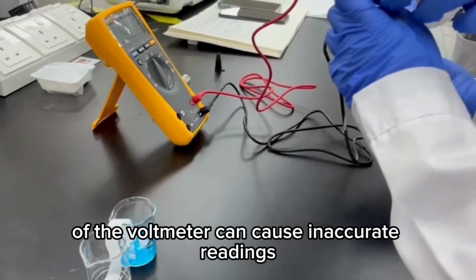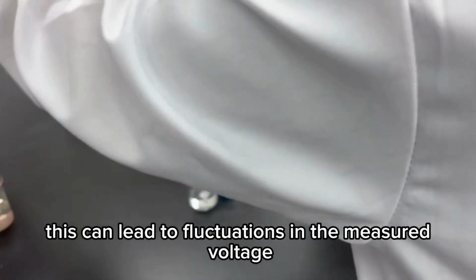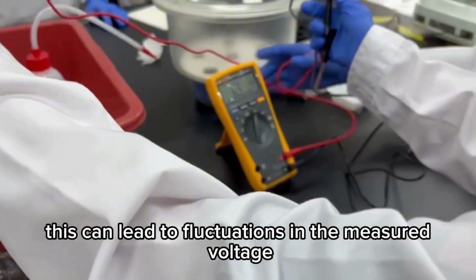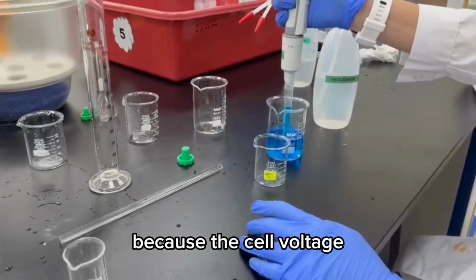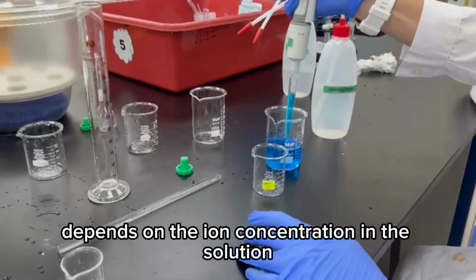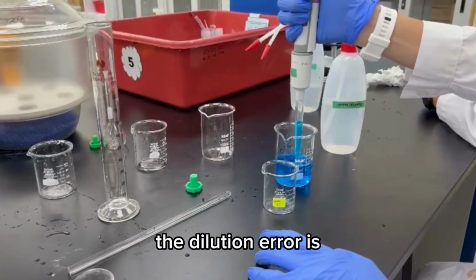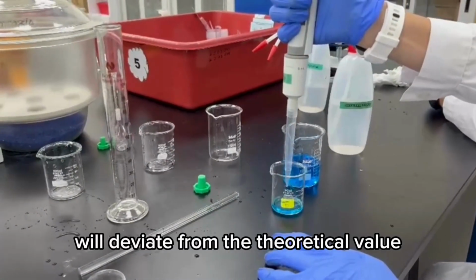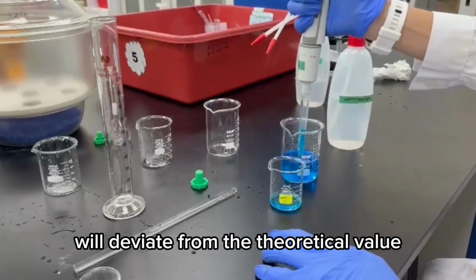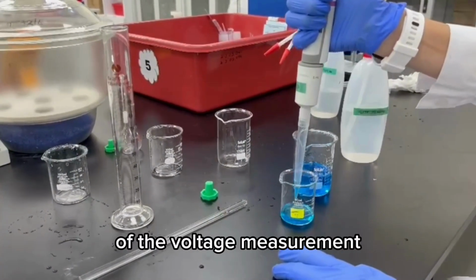Loose connections of the voltmeter can cause inaccurate readings because the electrical contact is unstable. This can lead to fluctuations in the measured voltage or even a lower voltage than the true value. Concentration affects accuracy because the cell voltage depends on the ion concentration in the solution. If the concentration is not exactly what is assumed, dilution errors or errors when mixing can cause the measured voltage to deviate from the theoretical value. Together, these two factors directly influence the reliability of the voltage measurement in electrochemical experiments.